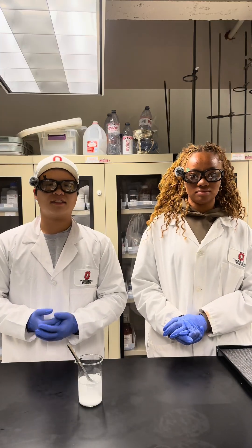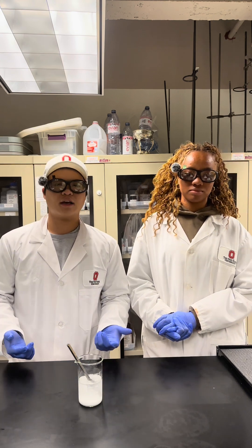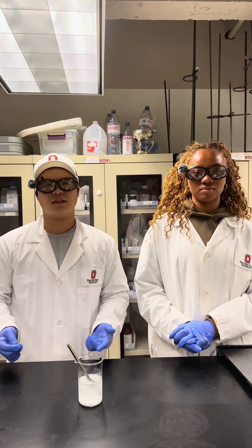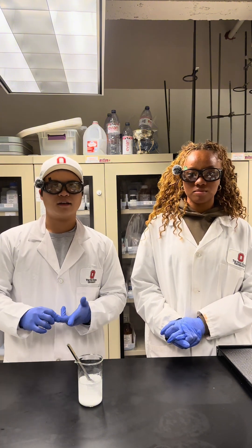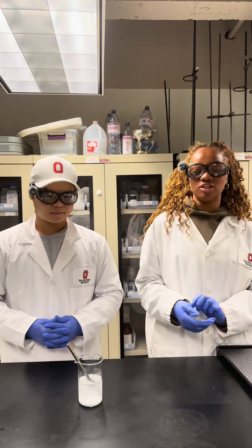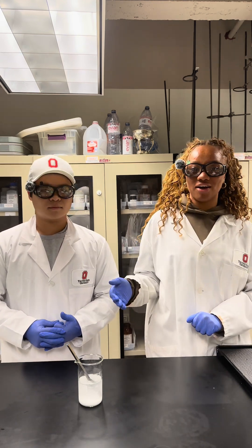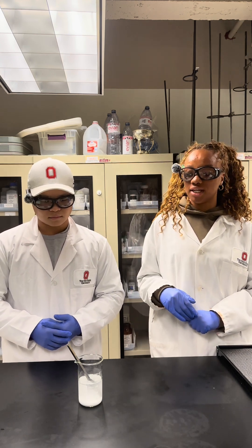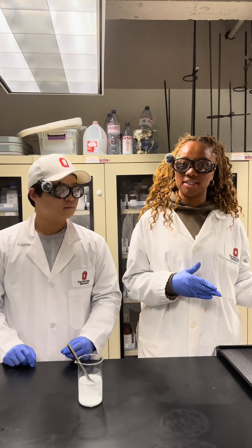The hydrochloric acid we just added into the solution is a strong acid, which means it dissociates completely into the hydrogen proton and the chloride anion. By introducing HCl to the solution, we have increased the chloride ion concentration. Increasing this chloride ion concentration then shifts the equilibrium to the left-hand side.